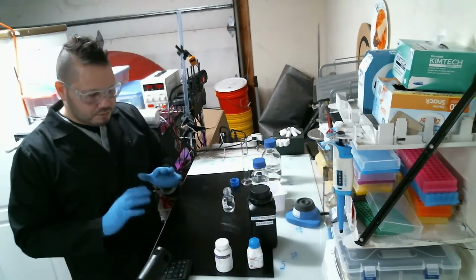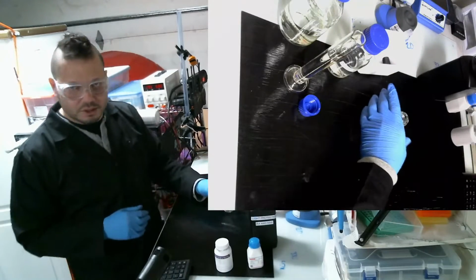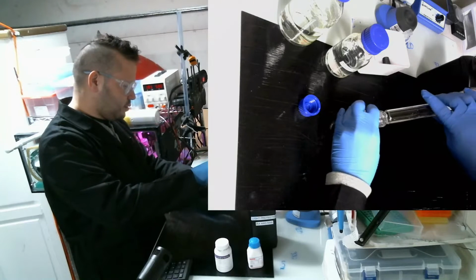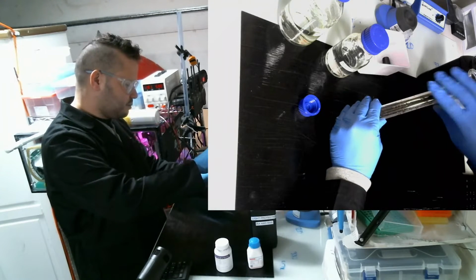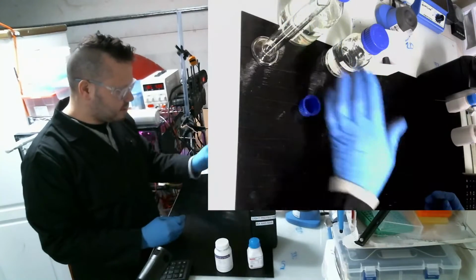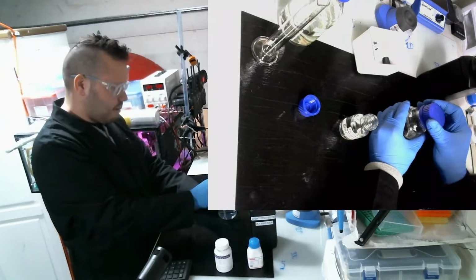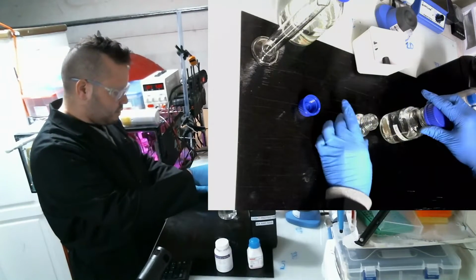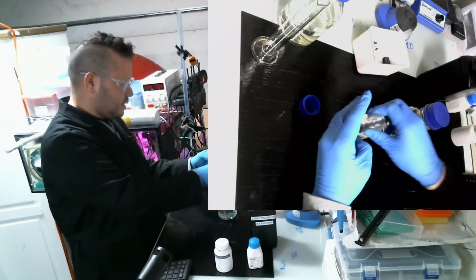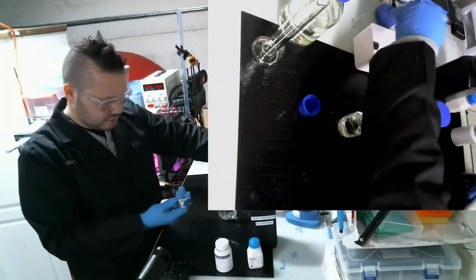So it's always important to isolate the variable you will be using, and you're only testing for one specific chemical in there. You have to recreate the solution the best you can, minus whatever your test compound is. Now, what I put in there was the culture salts, and now I'm going to put in some sodium hydroxide. 5 milliliters.